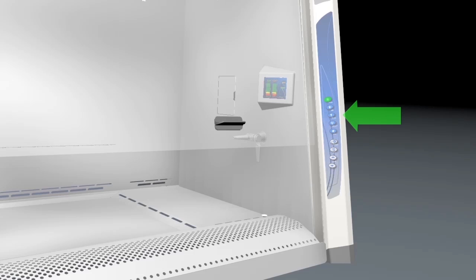Three, select the Axiom's B mode program to indicate that the BSC is connected to an exhaust system.